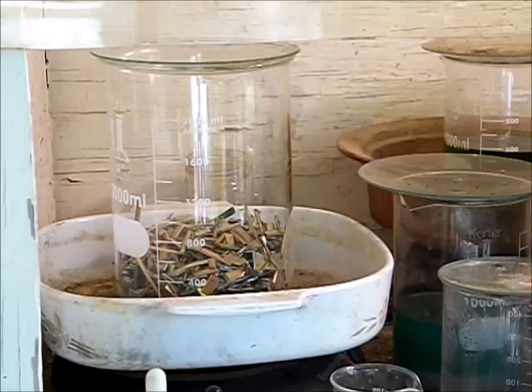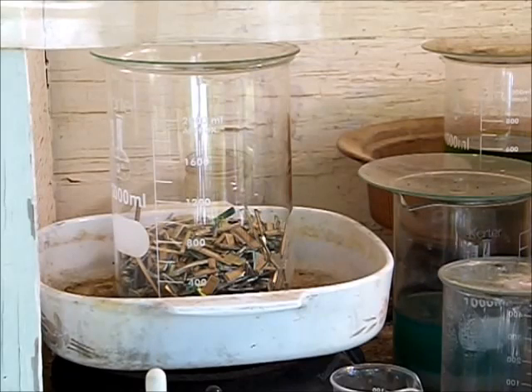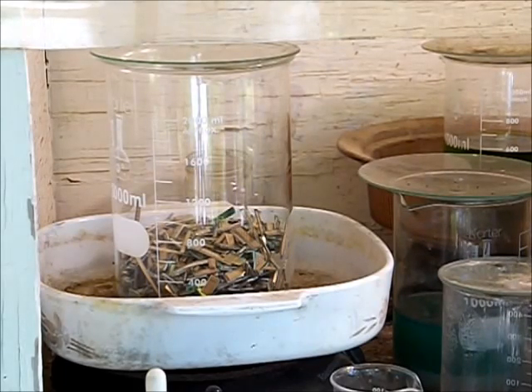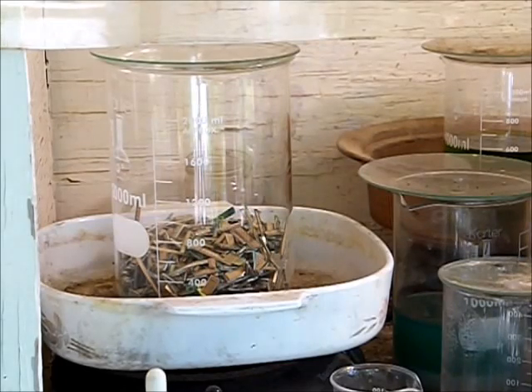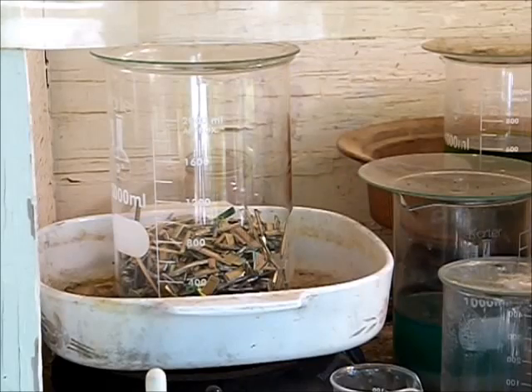This process is poor man's nitric acid made in situ, meaning that it's made in place at one time as the process goes along. What I use for the process is a solid nitrate, sulfuric acid, tap water, and of course your material that you're going to be dissolving.